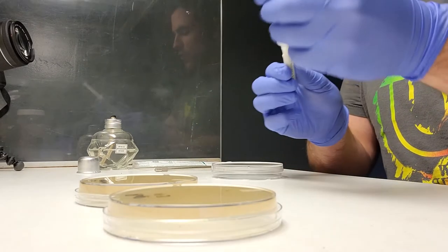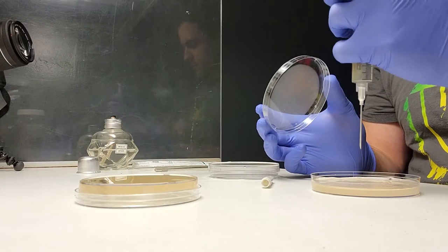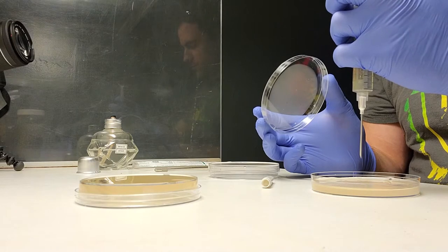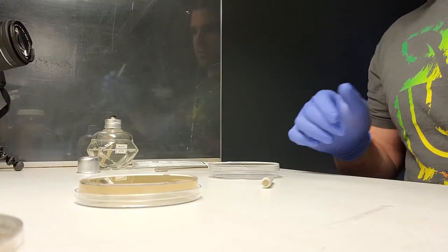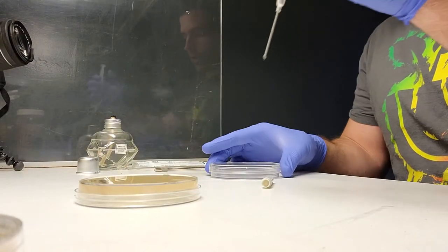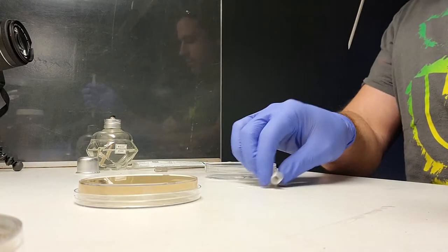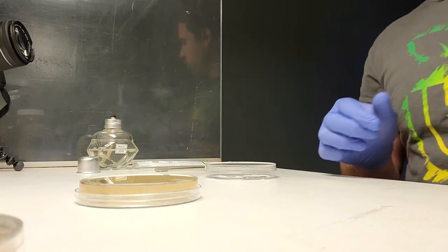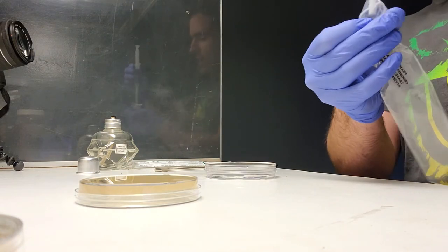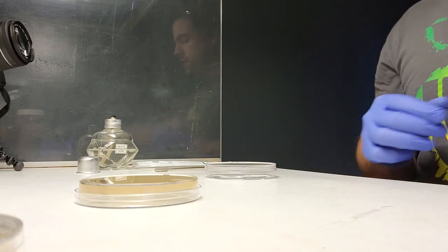While I'm here, I'm going to isolate this culture for my own purposes so I can save a clean culture. I've gone ahead and poured a little bit, maybe an ml, into a petri dish — but this petri dish is not sterile, and that's not what I'm aiming for.